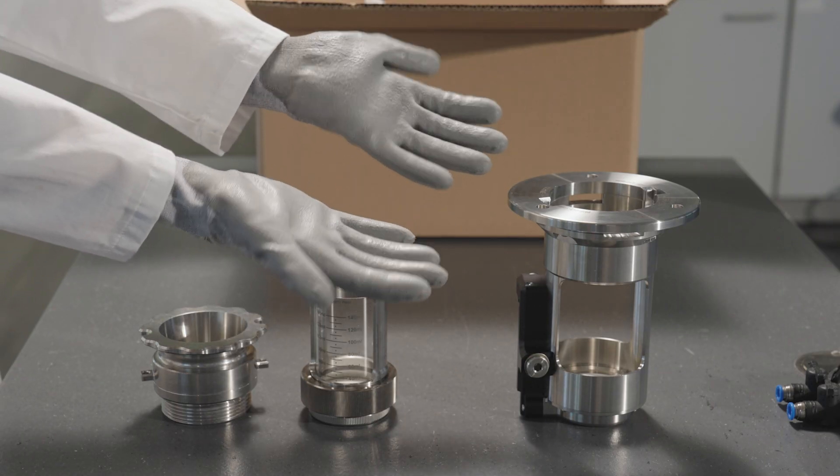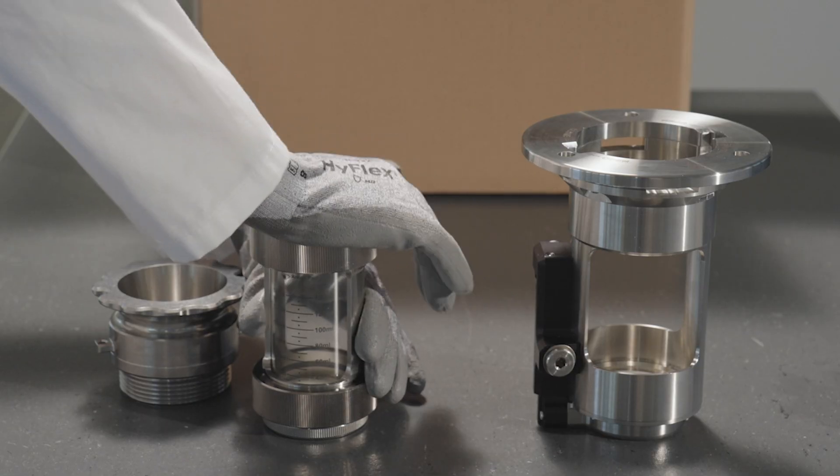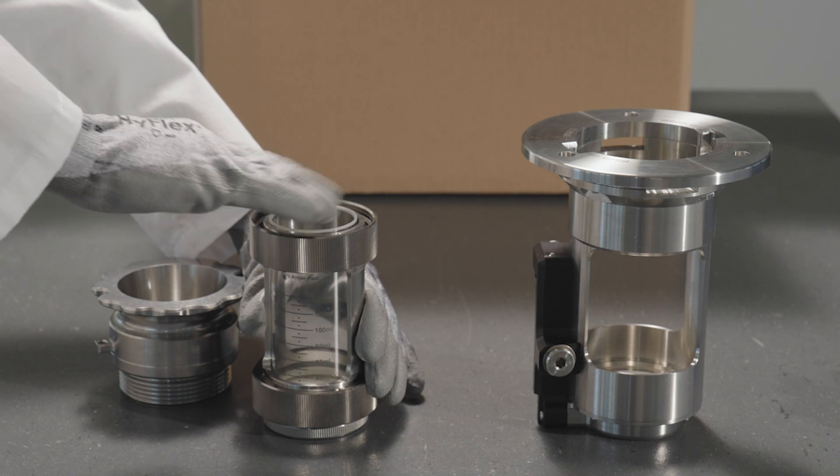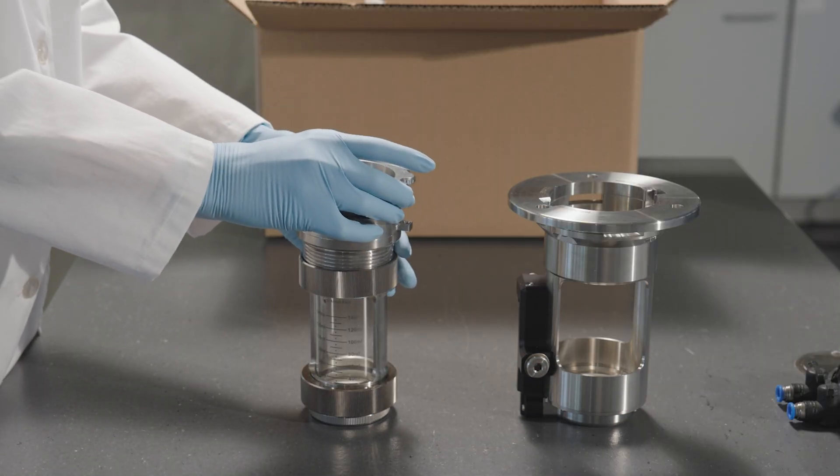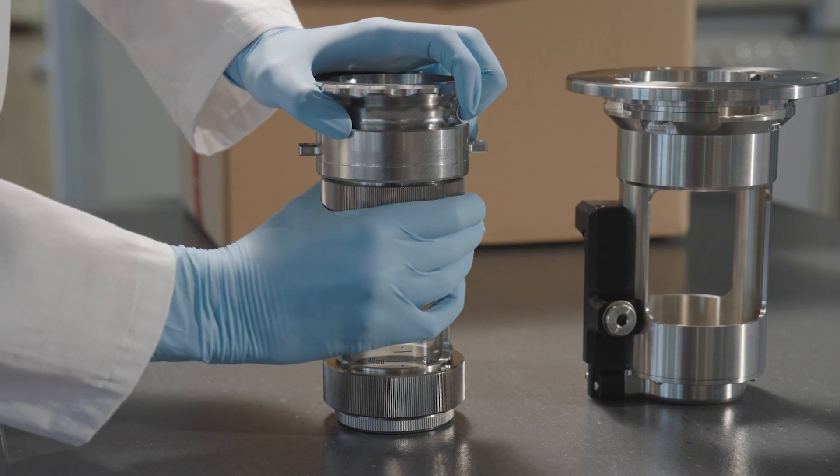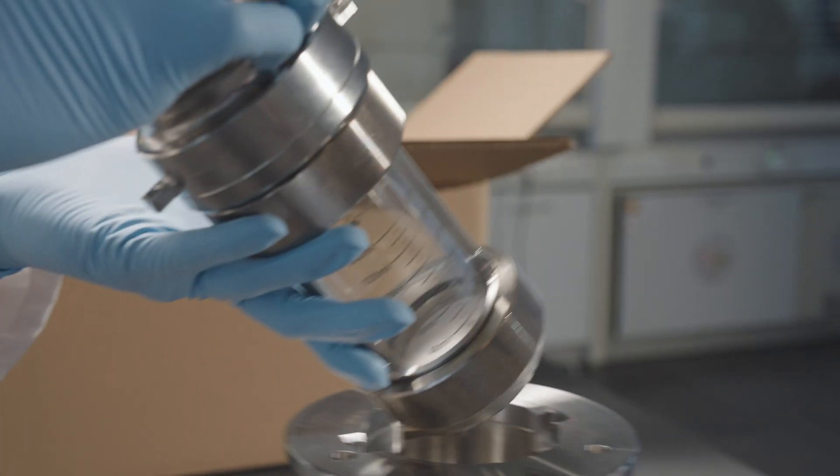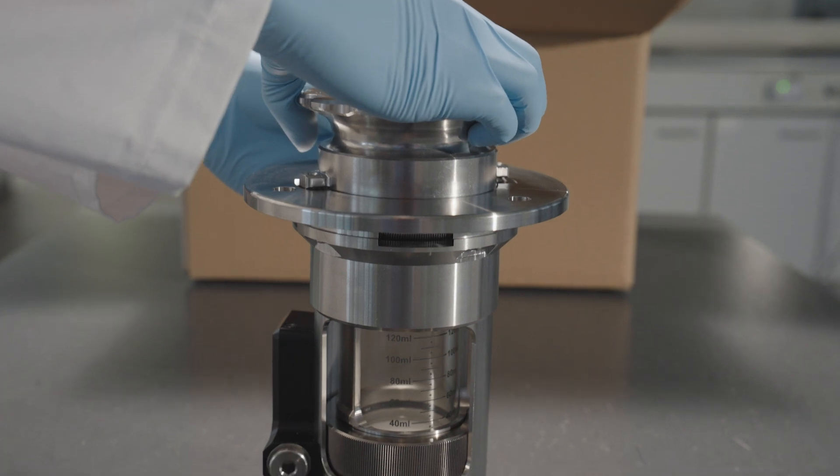Use safety equipment. Reassemble the measuring cell. Check tightness by reinstalling the measuring cell into the cell holder.